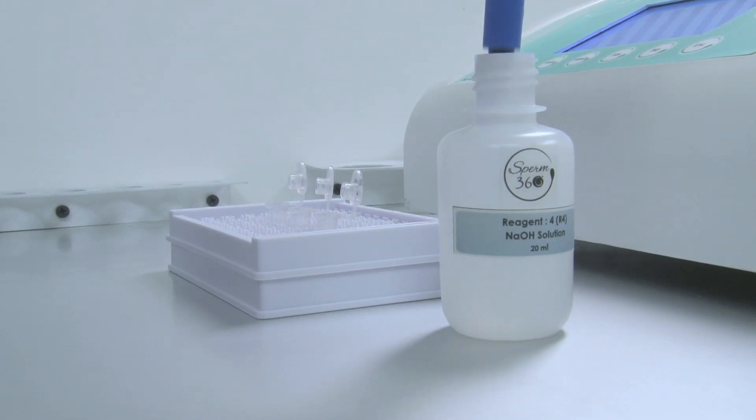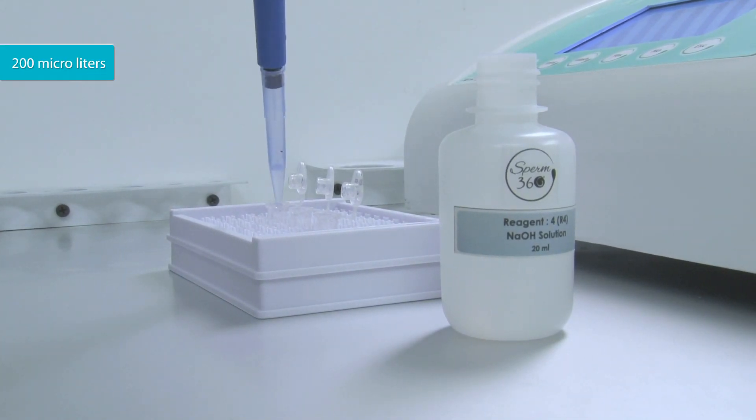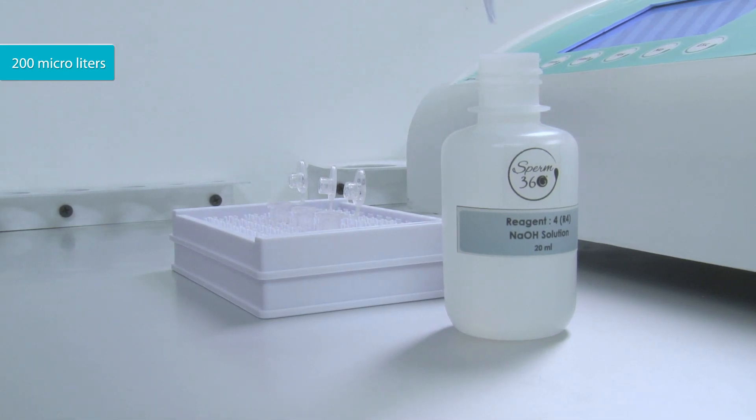Add 200 microliters of Reagent 4 to all the tubes and mix well.